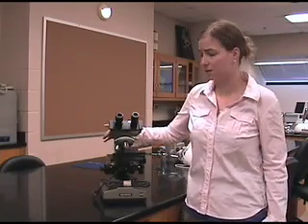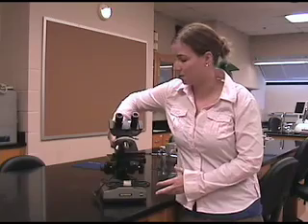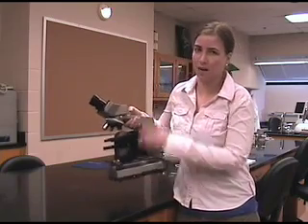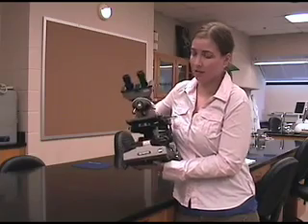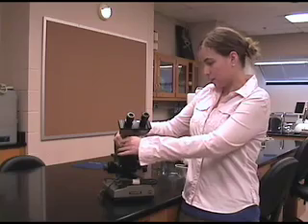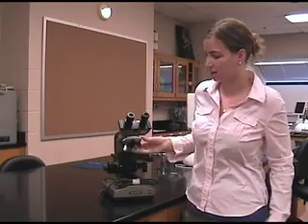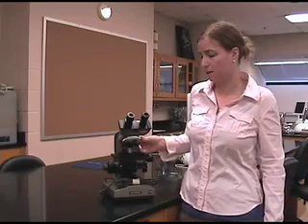One thing I want to tell you about before getting into how to use the microscope is the handling of the microscope. When you go to pick it up or move it around your bench, you want to pick it up by the back arm piece and support the base with your left hand. What we want to avoid is dragging the microscope across the lab bench, as that will dislodge the lenses within the ocular region as well as the objective region.